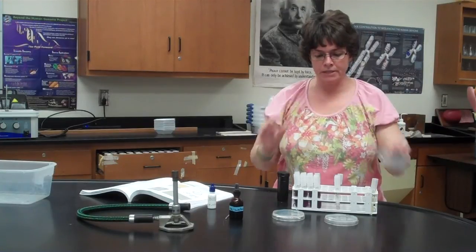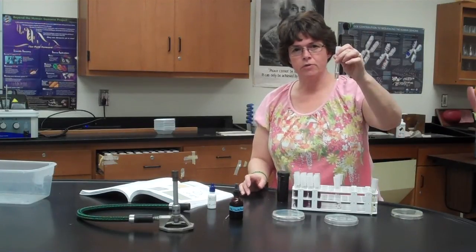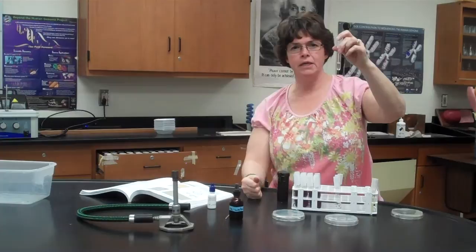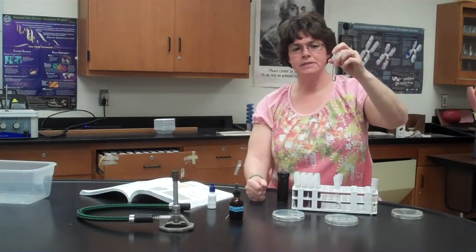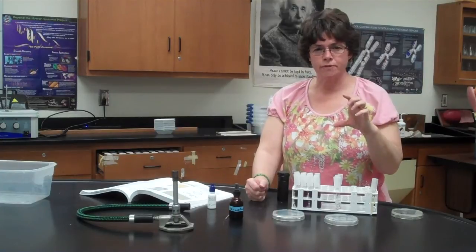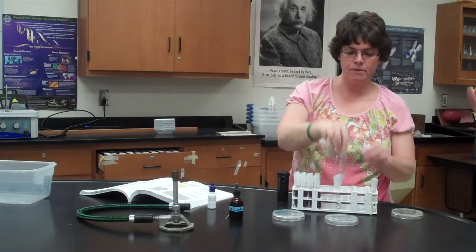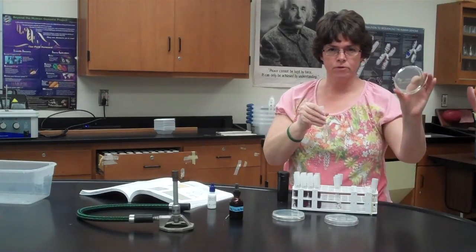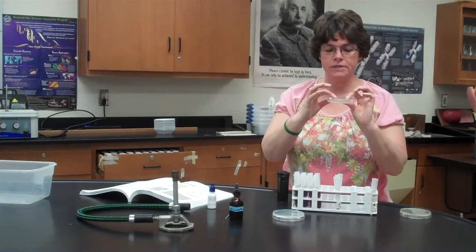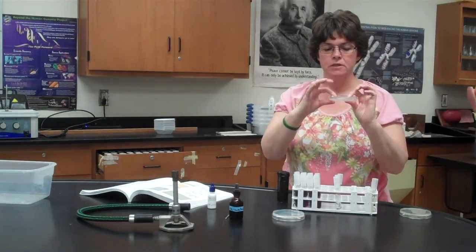But you're gonna take it from the plate, and you're gonna put it into the sterile water, and then you're gonna give it a little bit of swirl, so you see cloudiness and turbidity, and you see that it is evenly distributed. And then you're gonna have some sterile plastic transfer pipettes. They're in the plastic wrap, and they're the ones with the bulbs. And so basically from the sterile water that you took from the original stock plate, you're gonna put just 1 little tiny drop of the saline solution with the culture of the yeast on the appropriate side of the plate.